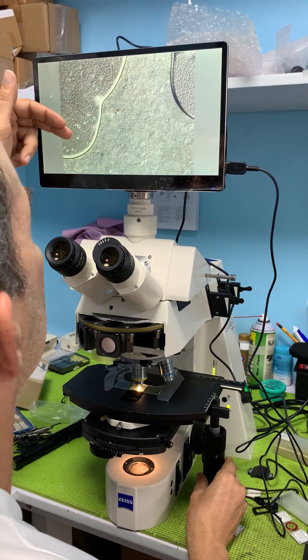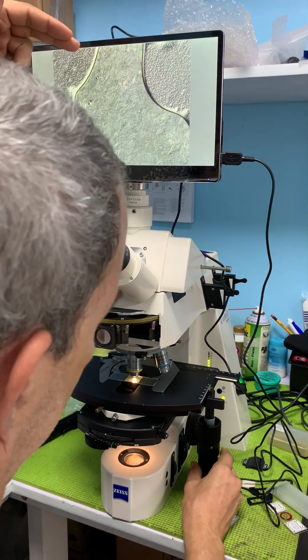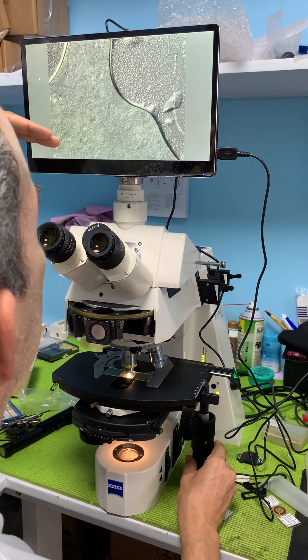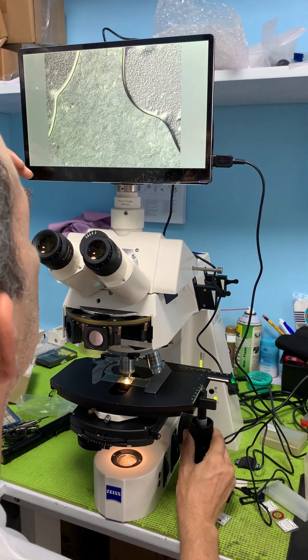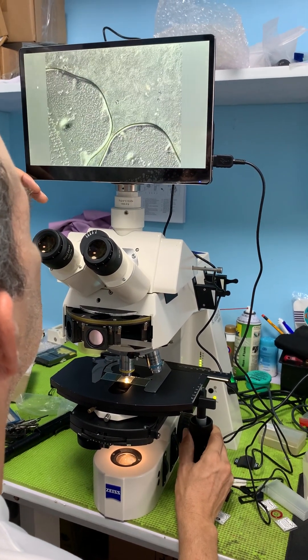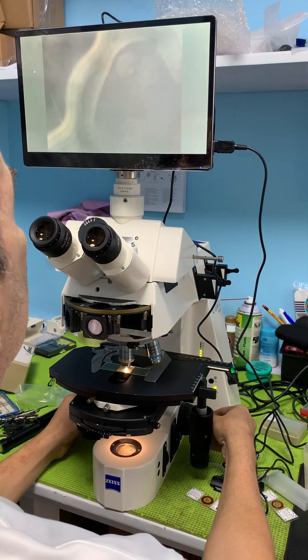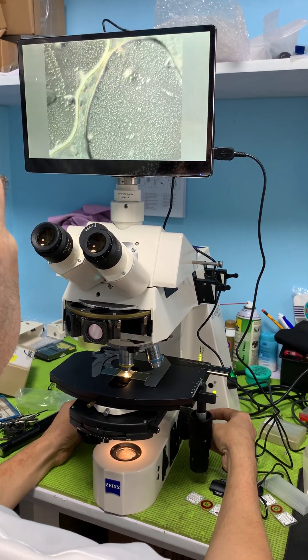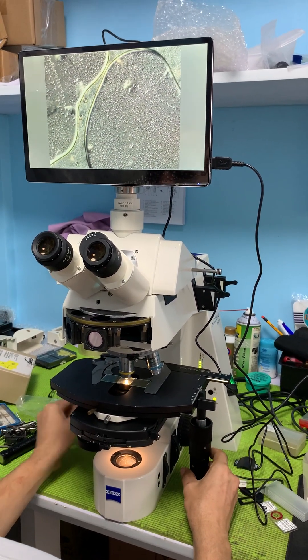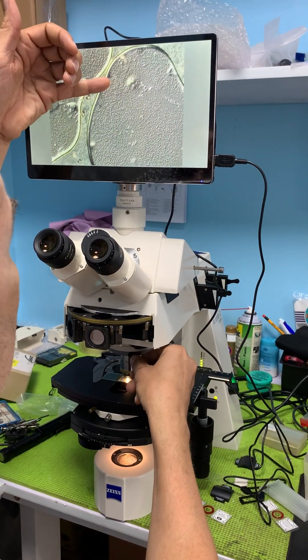Here's a bubble — I prepared the slide pretty quickly, so this is an air bubble. Even on an air bubble or other artifacts we can still see the 3D effect of whatever it is.